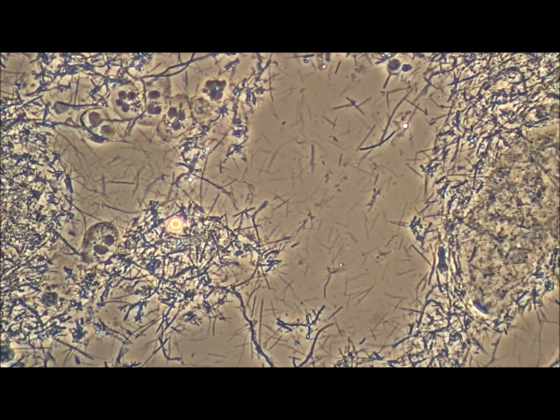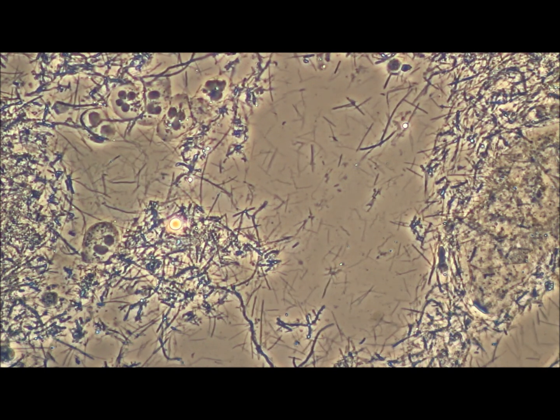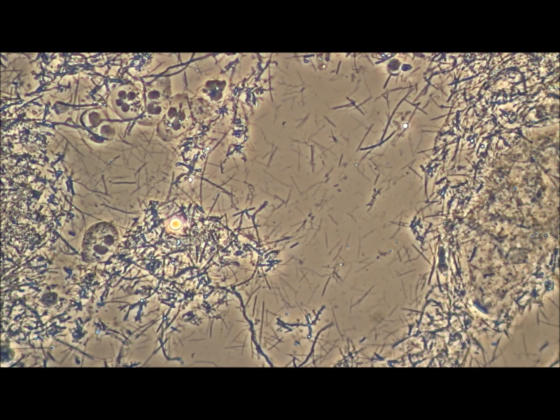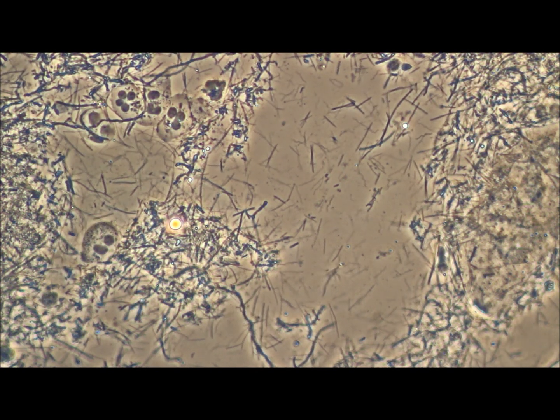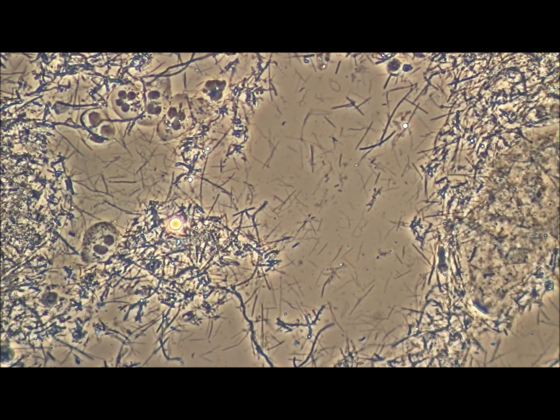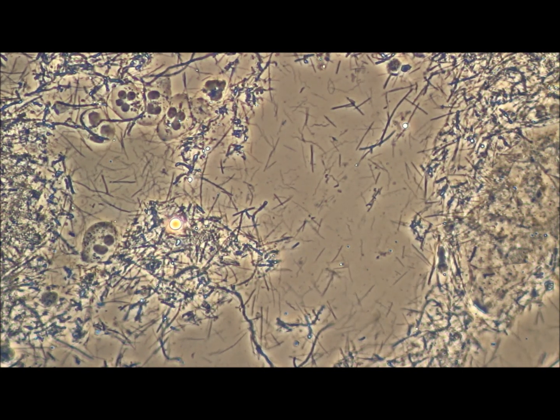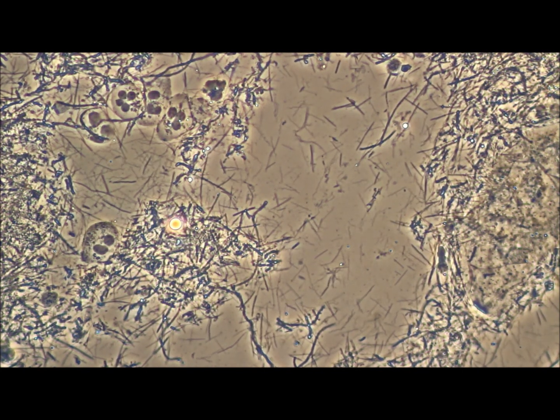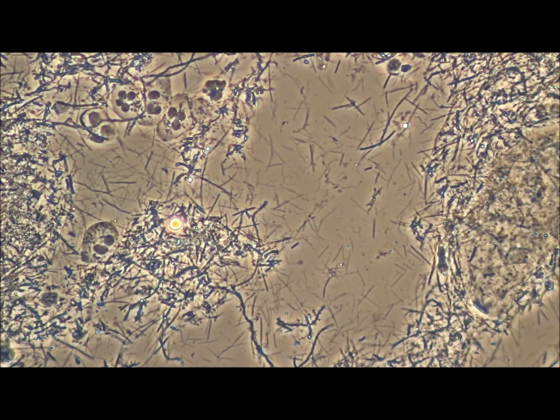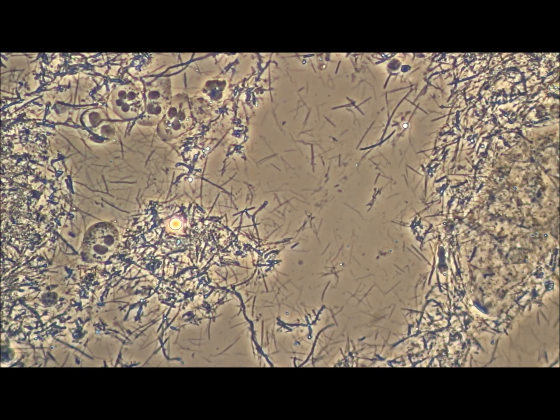Hi, this is Dr. O'Reilly, and here we have a sample of a slide from a patient showing a lot of different types of bacteria. The main one I wanted to talk to you about is the spirochetes that are here, visible as wiggly little strands, and they look like little water snakes.